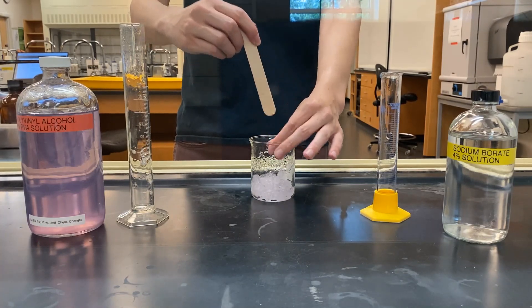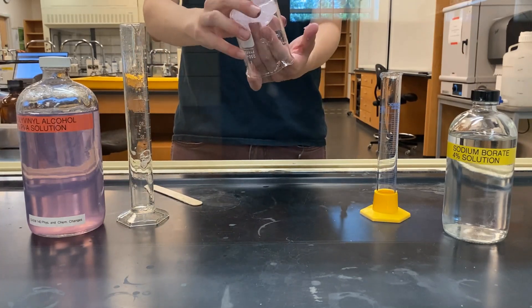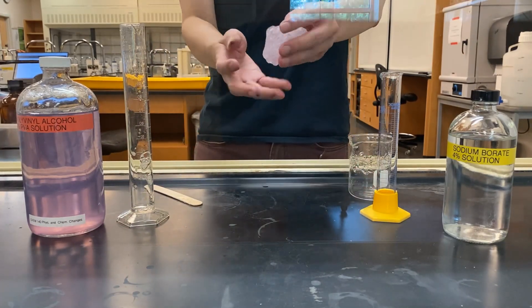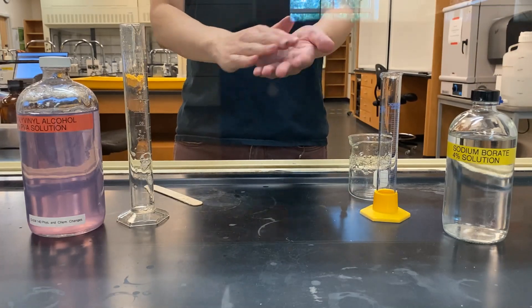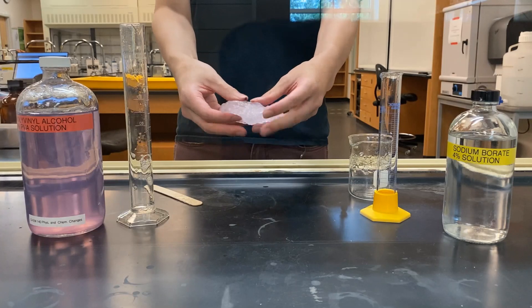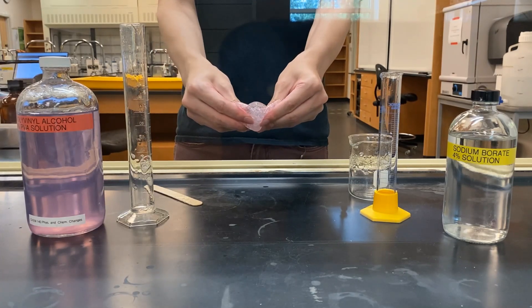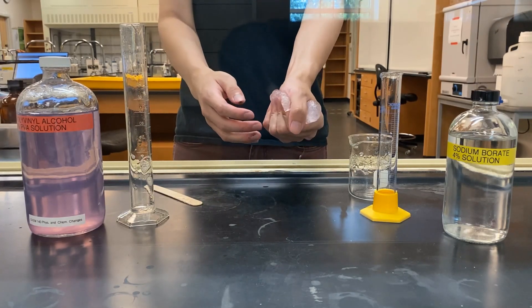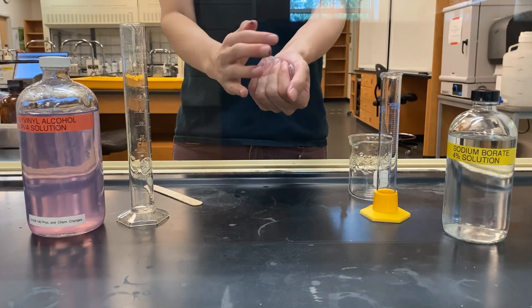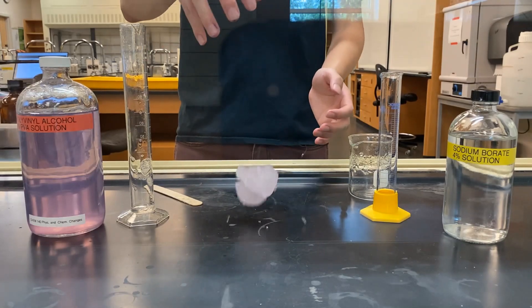The resulting substance is safe to touch with your fingers. Let's see what happens when it's manipulated. It can be rolled into a ball, it can be stretched and squeezed, it can even be bounced on the table.